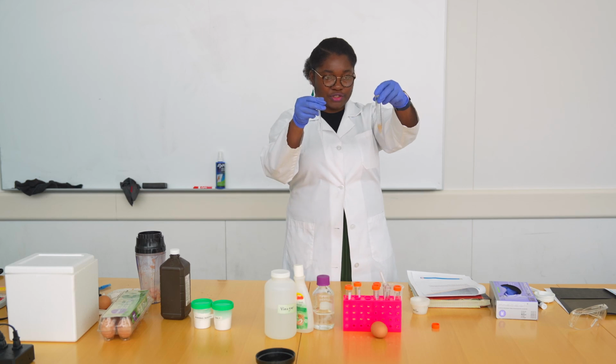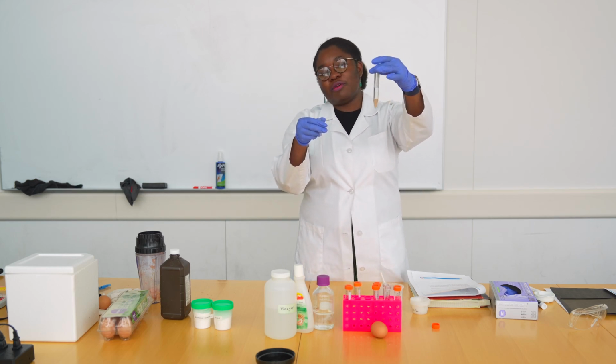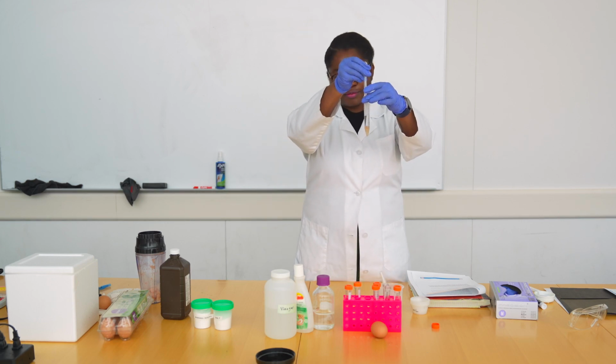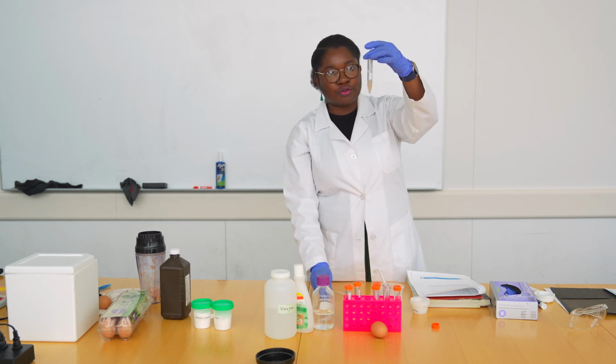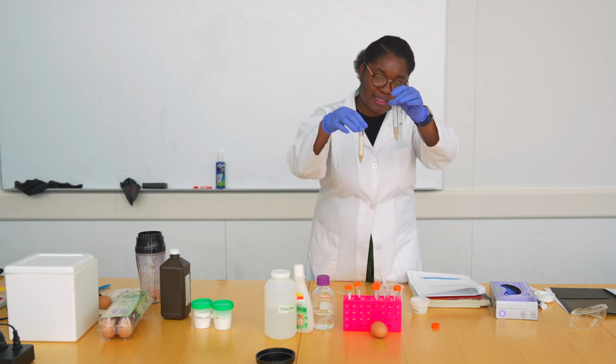And in our third reaction, again, I have 20 drops or 2 ml of the hydrogen peroxide in our test tube. This tube has vinegar, our potato juice, and now hydrogen peroxide. So there we go. We added our 2 ml. You could wait and observe what happens. There's still some bubbling, but not quite as fast as the first one.